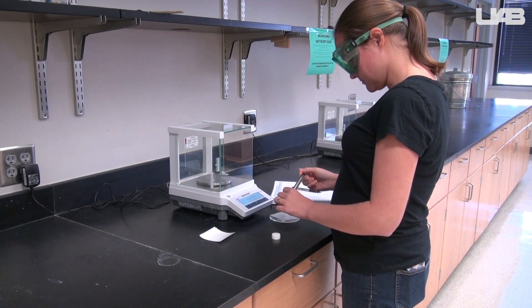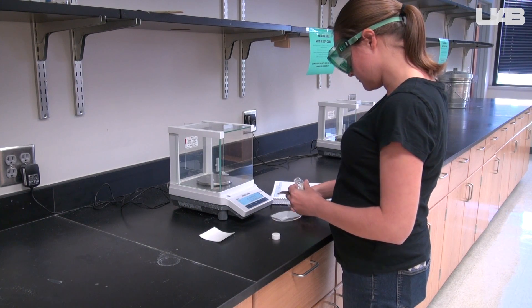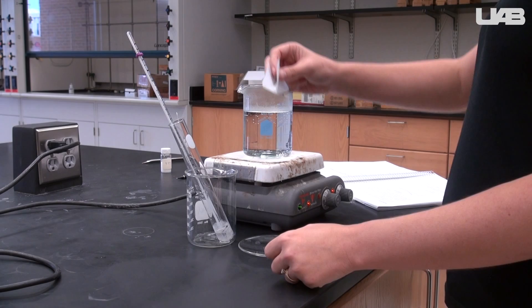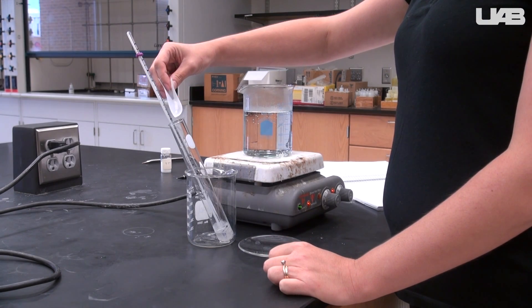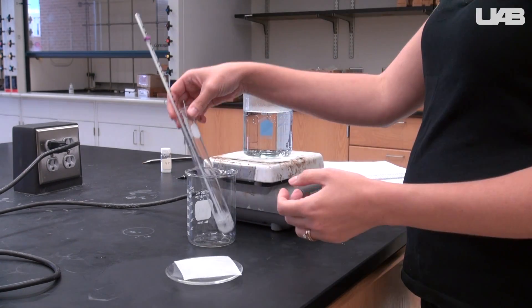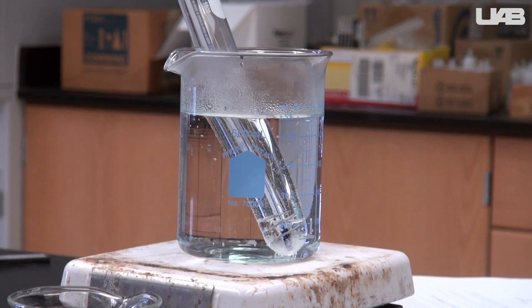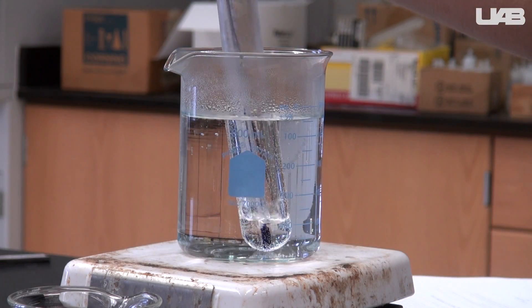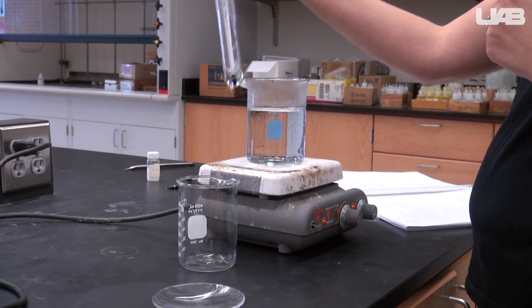Select a vial of unknown solid and record the number on the bottle. Measure out about 0.5 grams of the unknown and transfer the solid to the test tube containing the benzophenone. You will repeat the same procedure as before: place the test tube in the hot water bath, allow the crystals to melt, and when you no longer see any crystals and the solution is clear and colorless, remove the test tube and place it in the beaker.